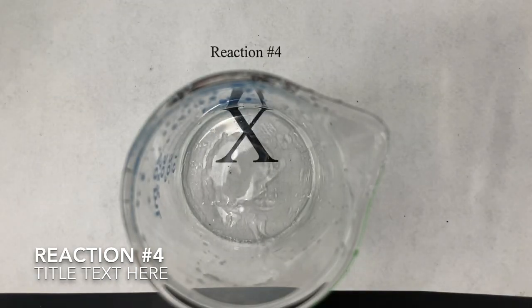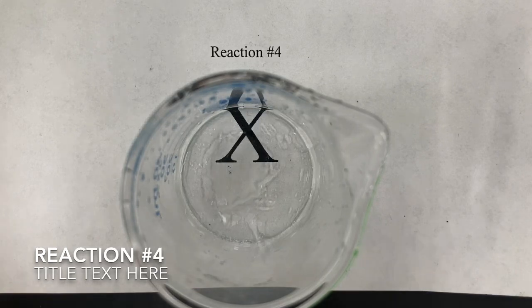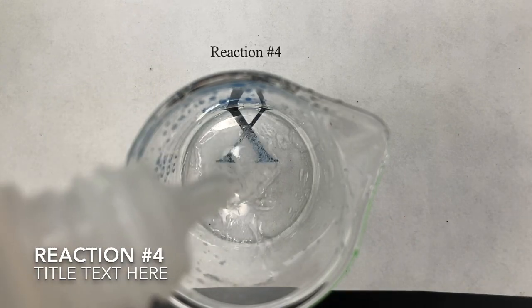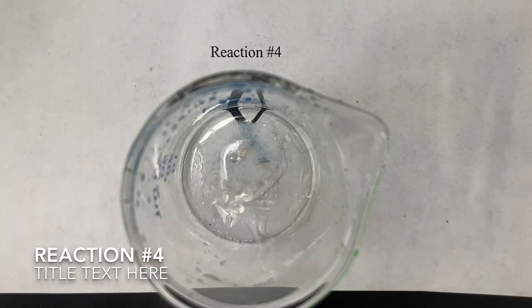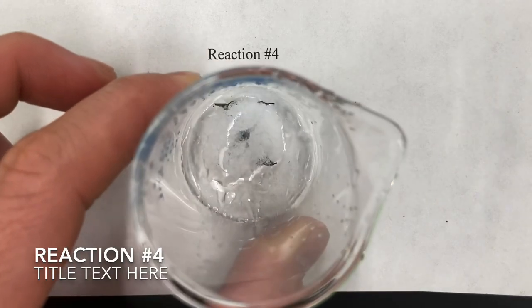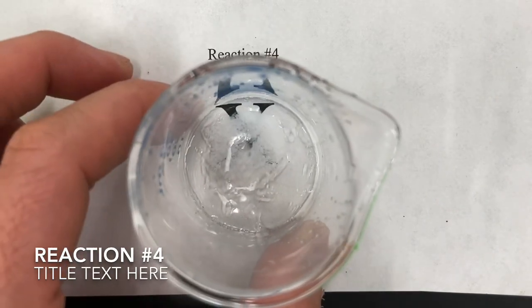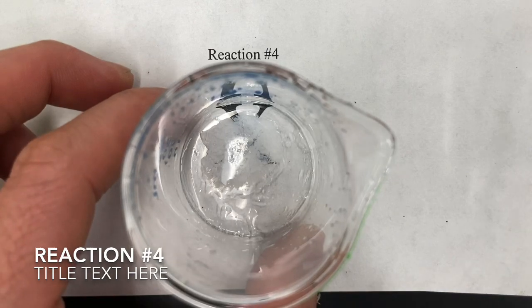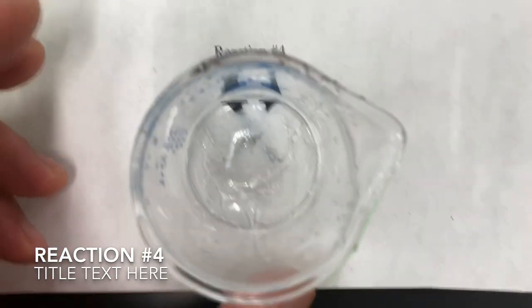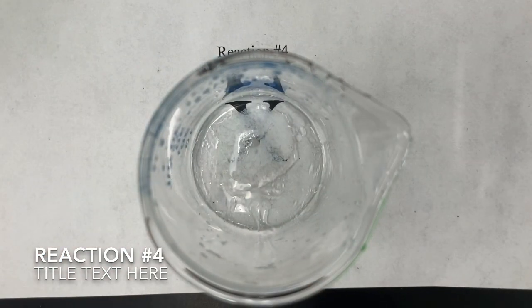All right, hopefully you made your prediction. If you haven't, go ahead and do that. I'm going to test it out now by adding some lead nitrate. So 2 drops. Let's see if we see any notable change. Okay, so we can see that a white precipitate has formed here. Remember, a precipitate is a solid, and we can tell that a white precipitate formed because it covers that X here. So definitely some kind of white precipitate has formed. Which way do you think equilibrium has shifted then if we see this white precipitate?